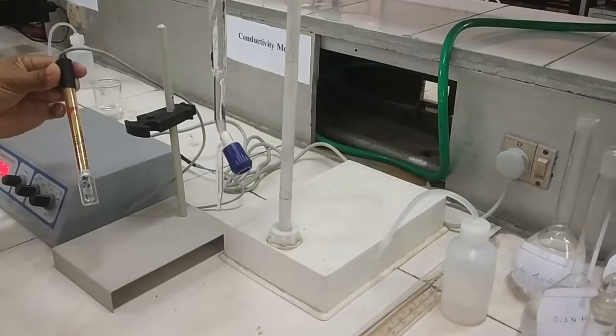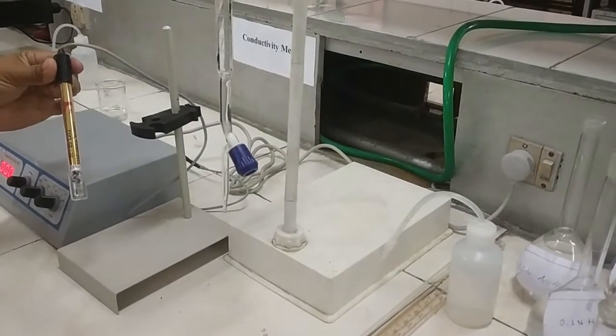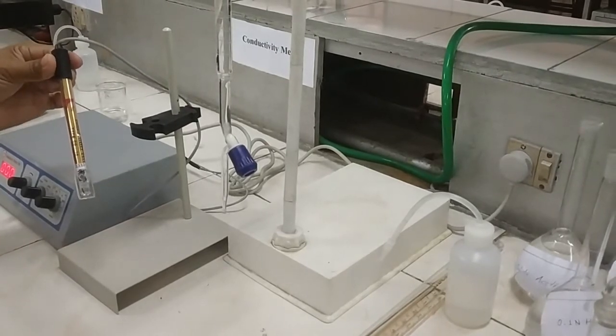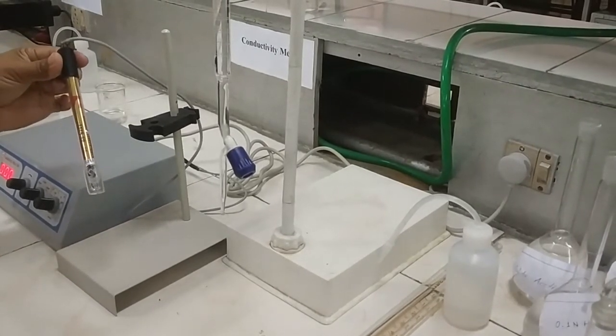We have calibrated the instrument by using 0.1 normal potassium chloride solution.